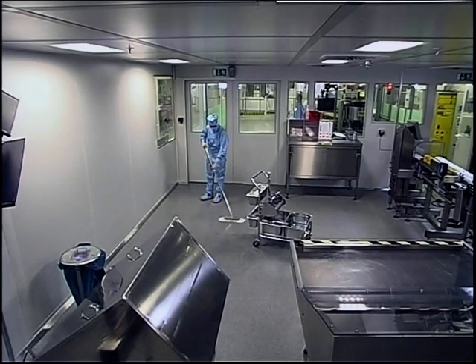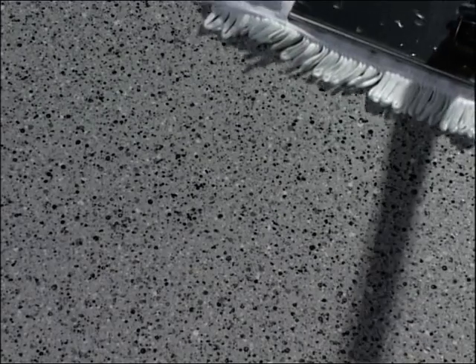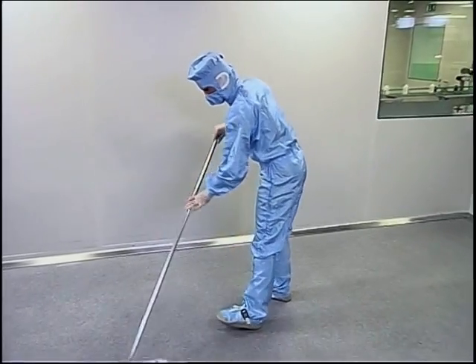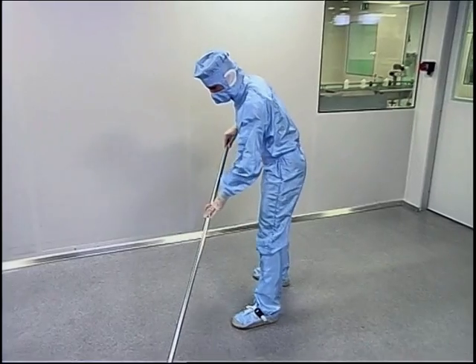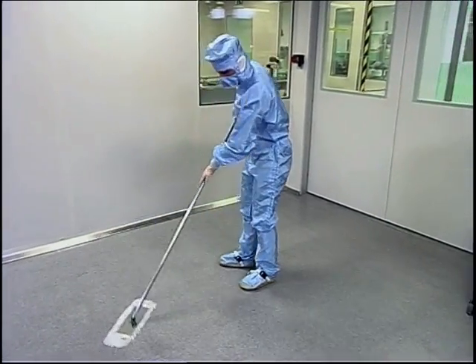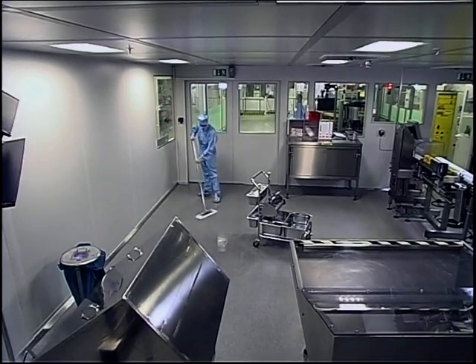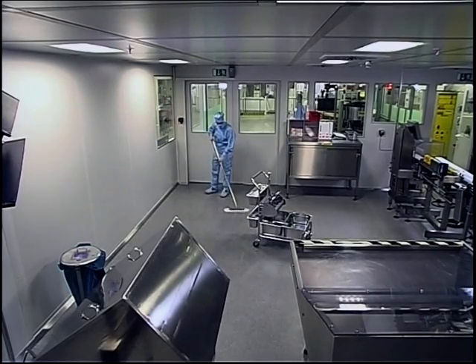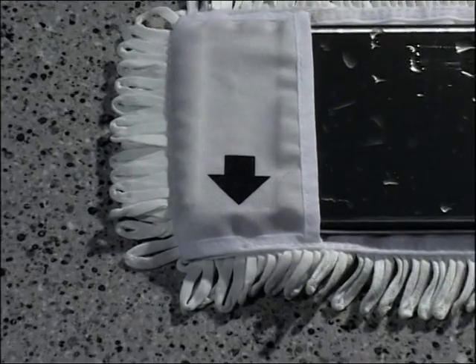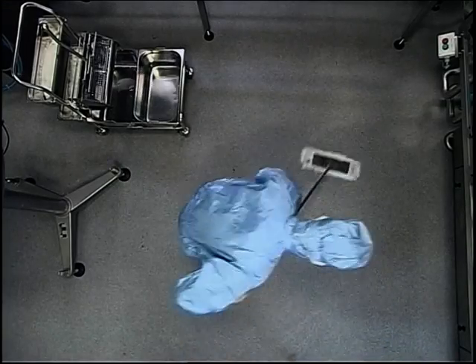Here we should stress again that in order to prevent the microorganisms and dust particles from coming off the mop again, you must never change the direction taken by the mop cover, because the dirt is practically always pulled along by the mop. Exactly, and only this method guarantees uninterrupted wetting of the surfaces to give the best possible cleaning and disinfecting results. Move backwards towards the airlock door. The mop cover is marked with an arrow to show you which way to go.